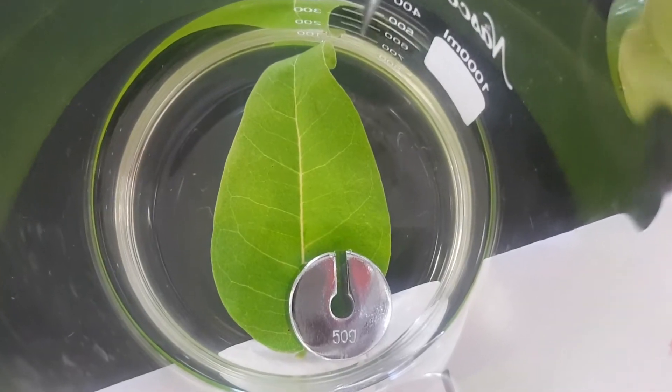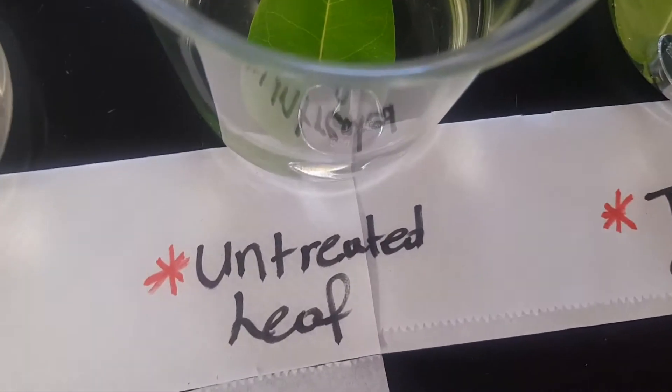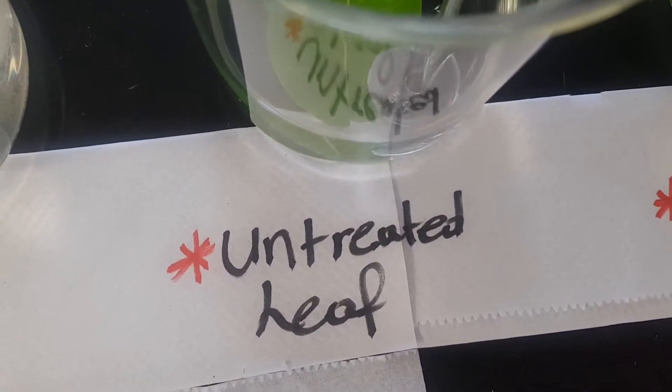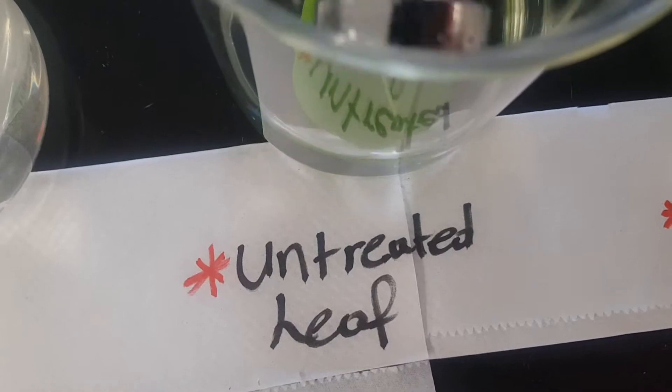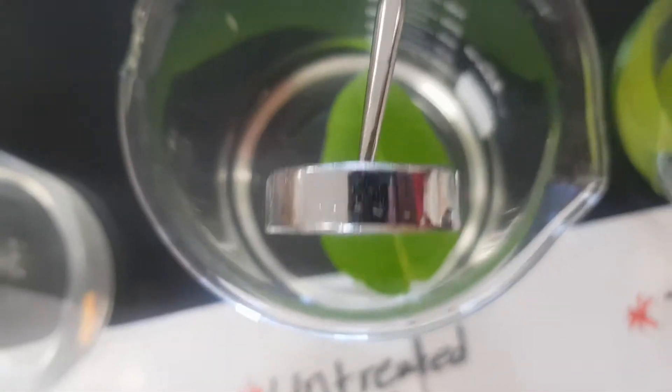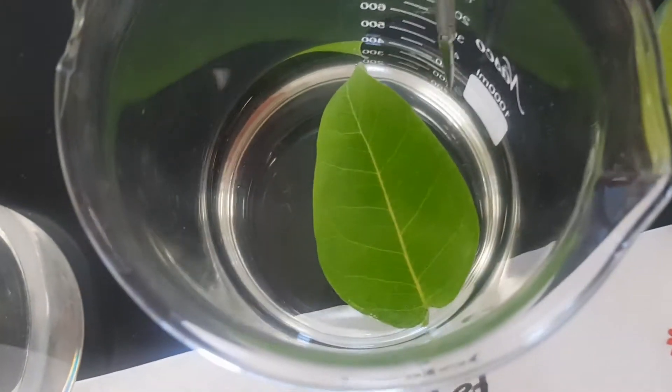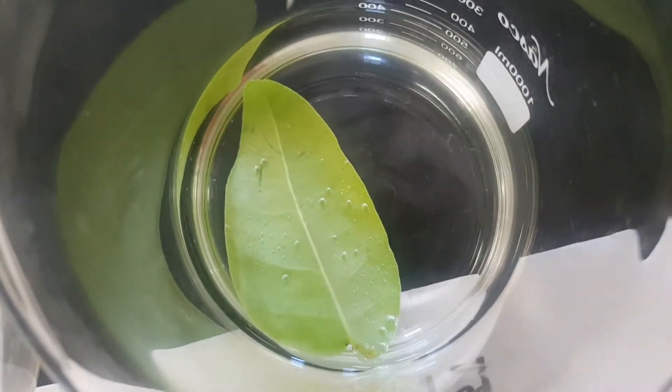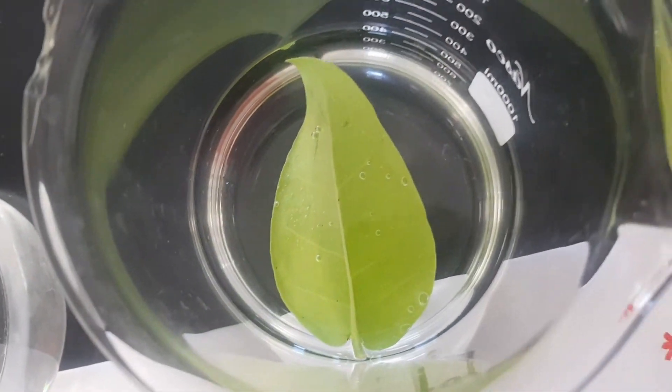This is after some time. This is the leaf with no Vaseline, so this was untreated. Just want to observe and see what's happening with this leaf. Most of the bubbles are under the bottom of the leaf, if you have noticed that.